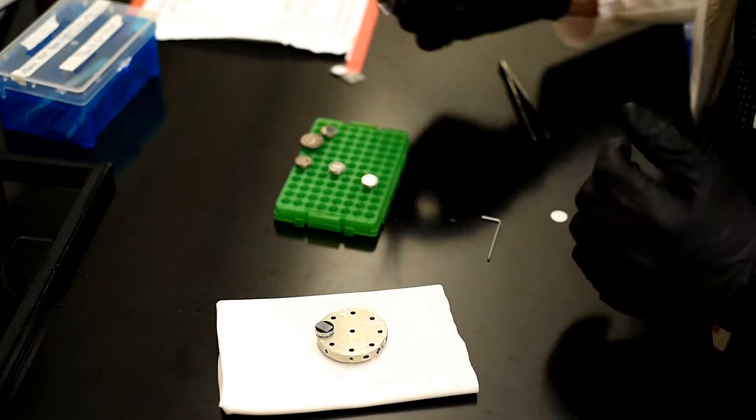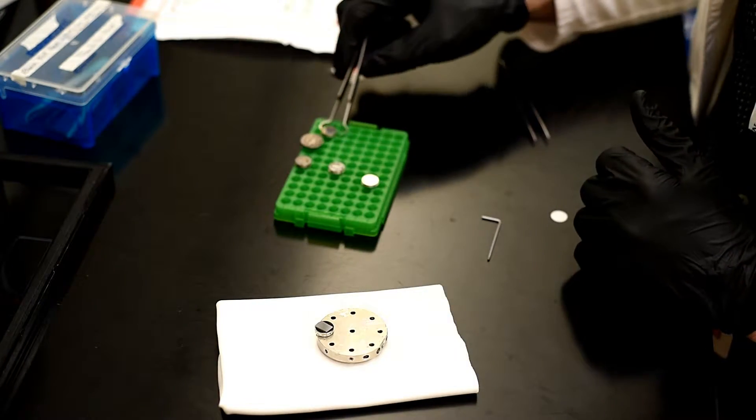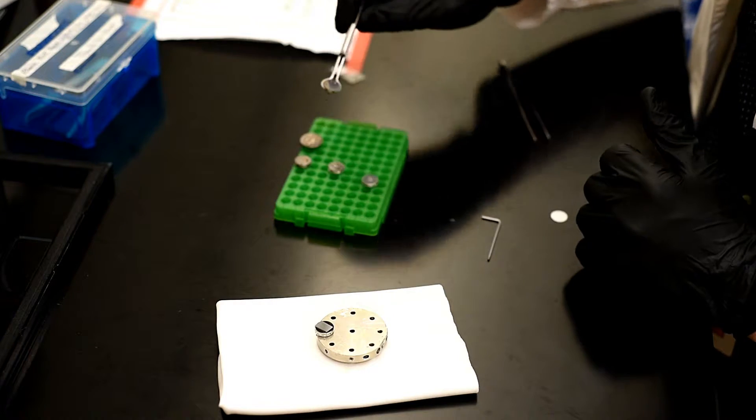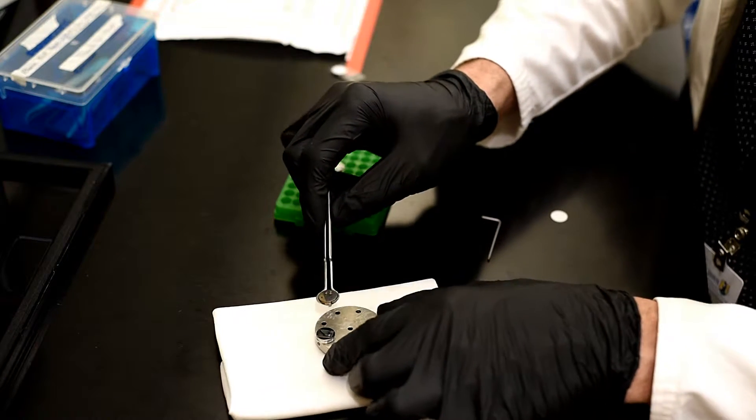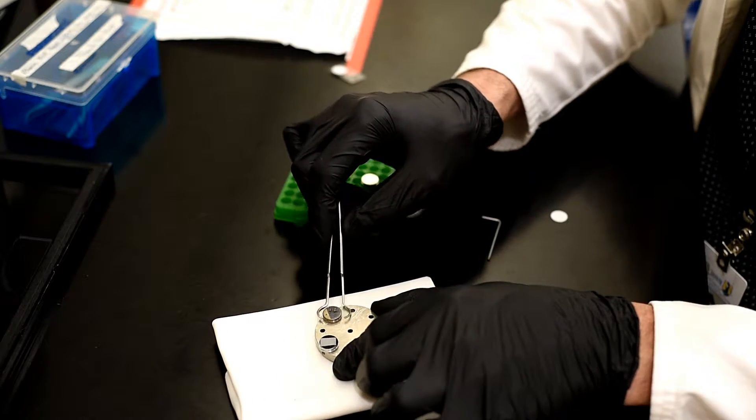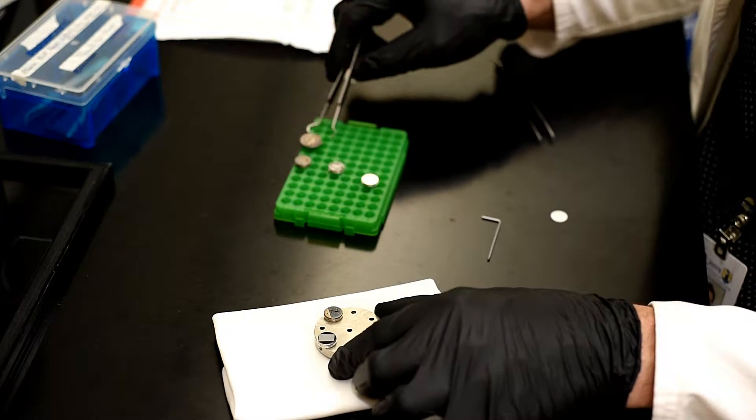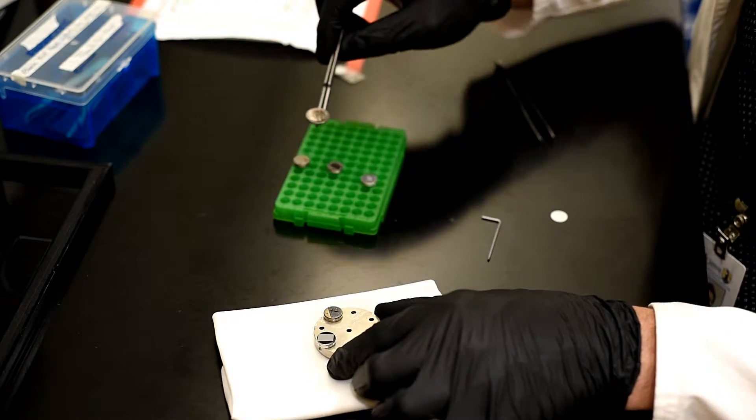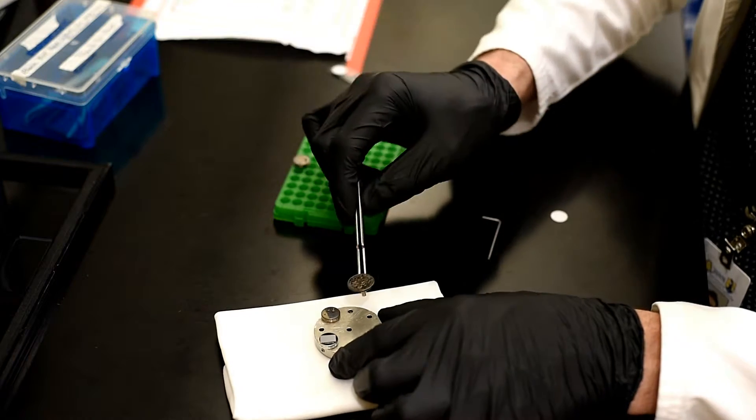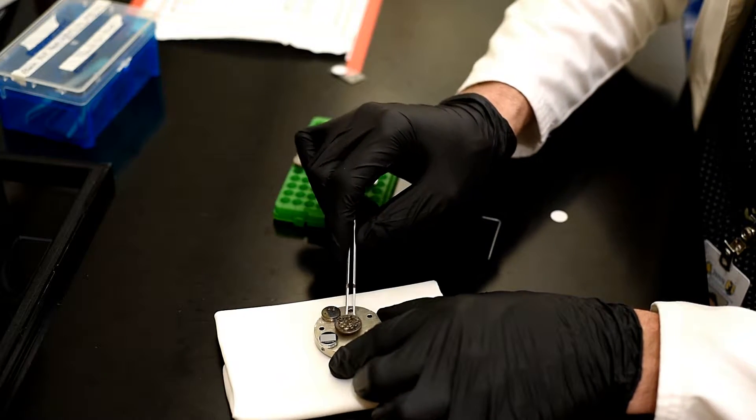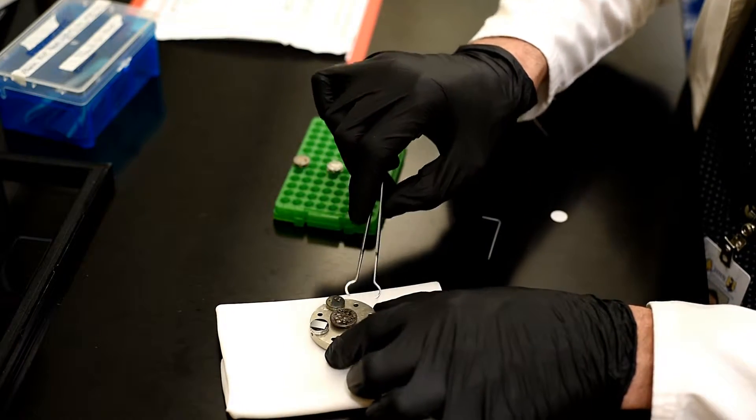So we will load, just for today, the silicon and these fruit flies that I've already sputter coated. And a dime, just for a sense of scale.